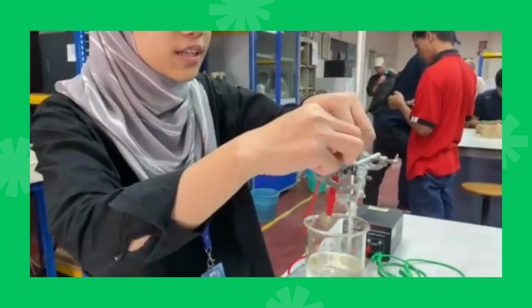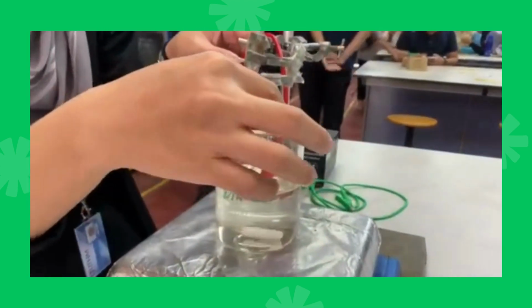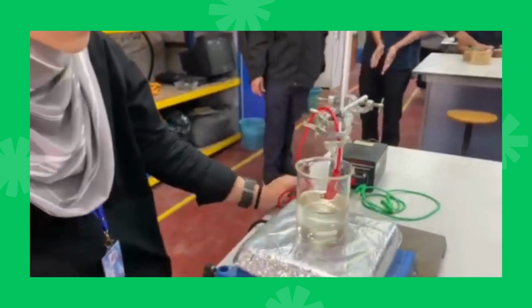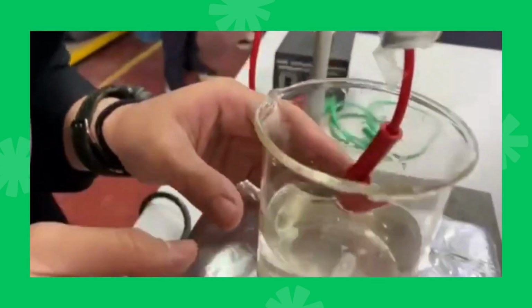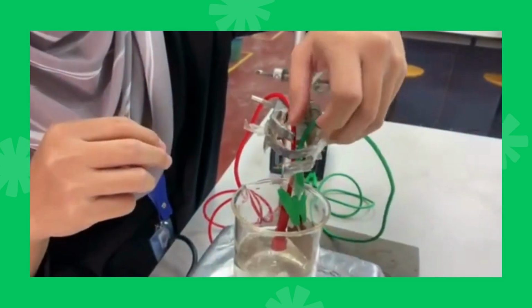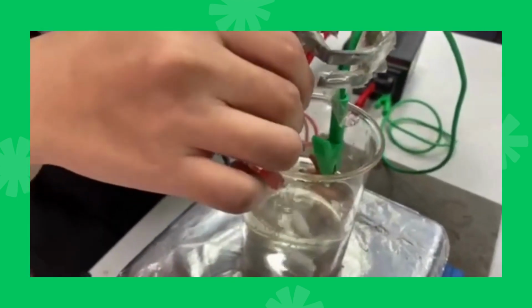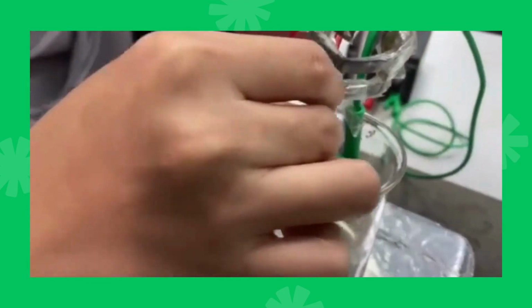Okay, for the first step, we connect the coin. We use this coin for our anode. So we bury it, we put it in water. Don't go too deep, just like that, so that the magnet doesn't touch. For the cathode, we use copper. Okay, we connect it with the negative clip, and then we put it inside also. Don't touch the positive clip. Just like this.